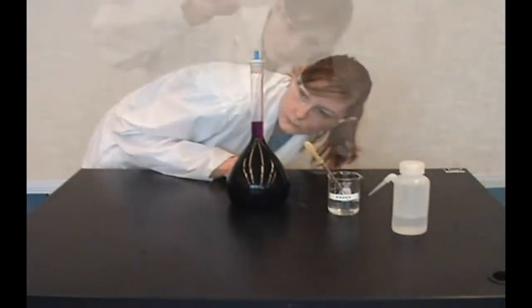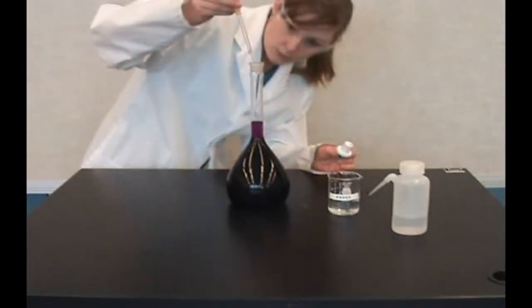Check the meniscus. If needed, add a few more drops of water.